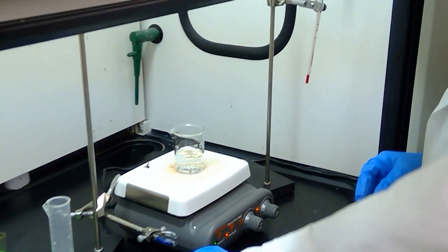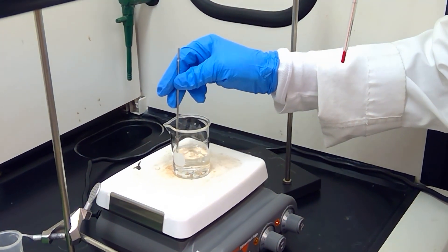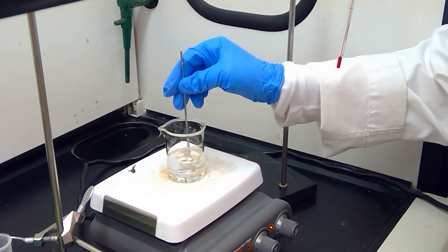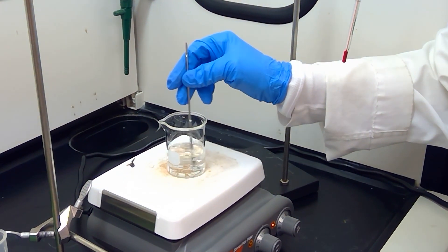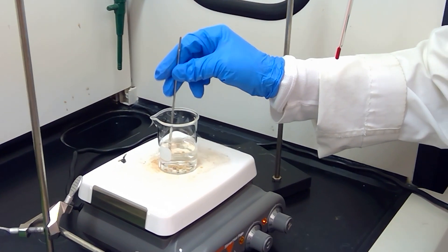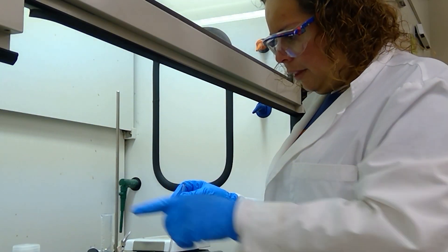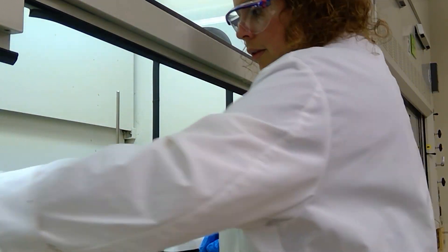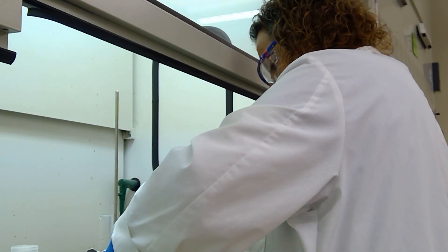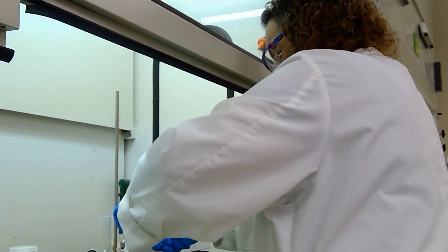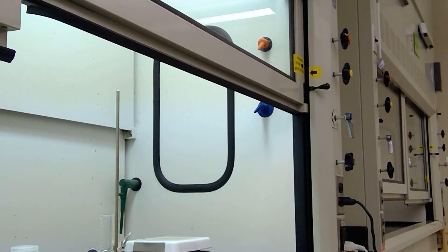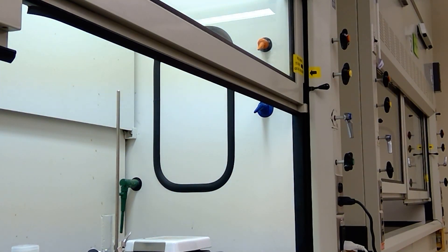And as we get closer, we will see that the solution is now a little bit more viscous due to the addition of the sodium hydroxide. And I'm going to continue stirring here until we get this solid dissolving. And then we have the diazonium salt solution as well. So, repeat the whole process here.